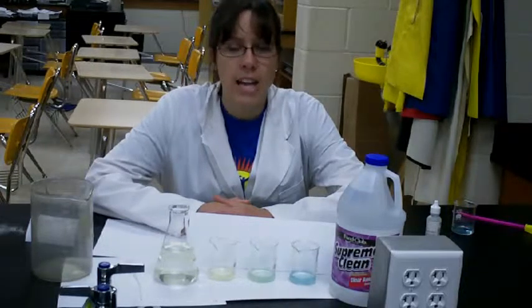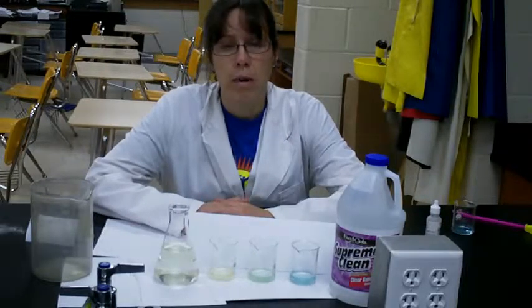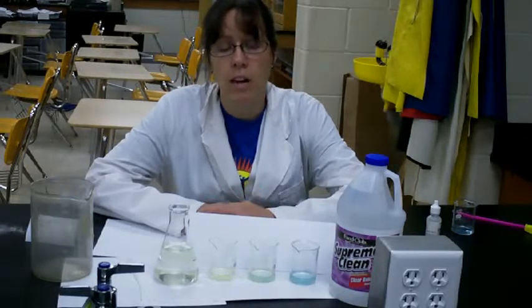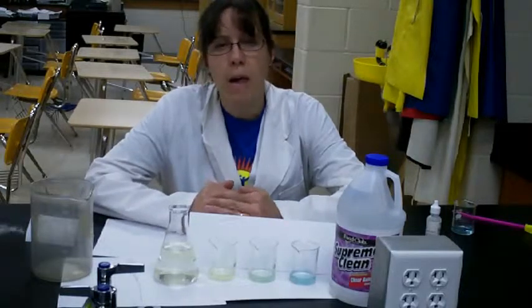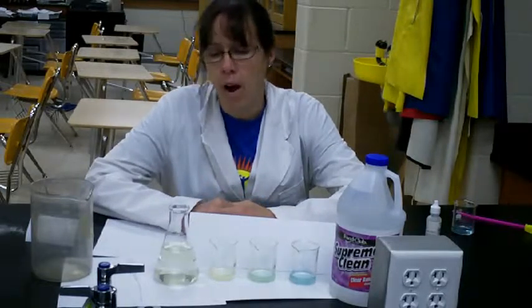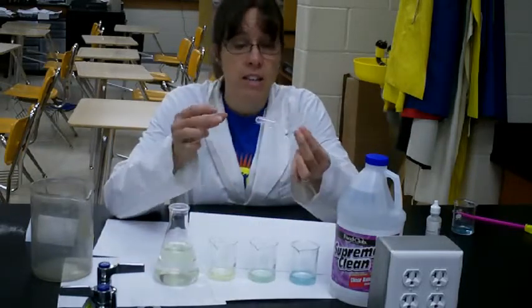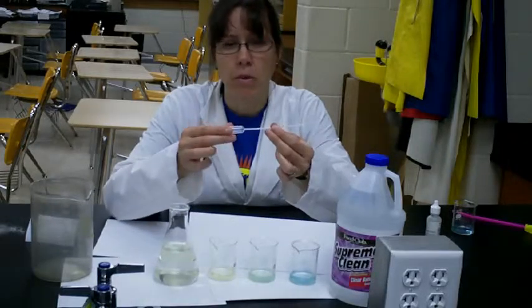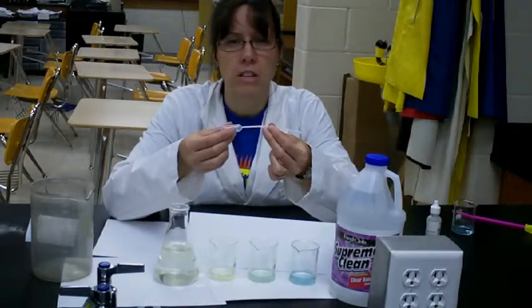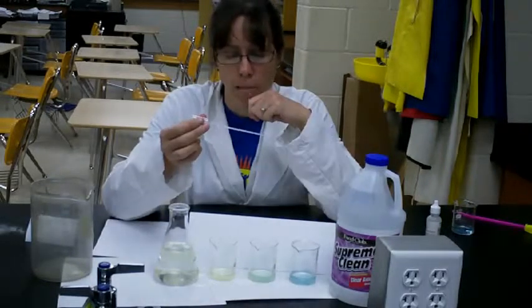And I tested that out on a sample of 15 milliliters with my bromothymol blue indicator in it. I bubbled some of my breath through there and then tested it out to make sure that it changes back within about 50 drops of the stock solution. And Mr. Johnson had these very nice droppers, and have your students play around with whatever droppers you use, because it's very easy to ruin your entire sample if you're not careful with your dropper.